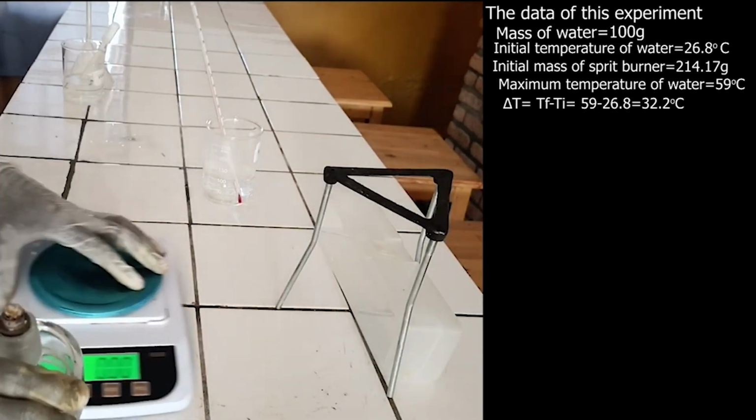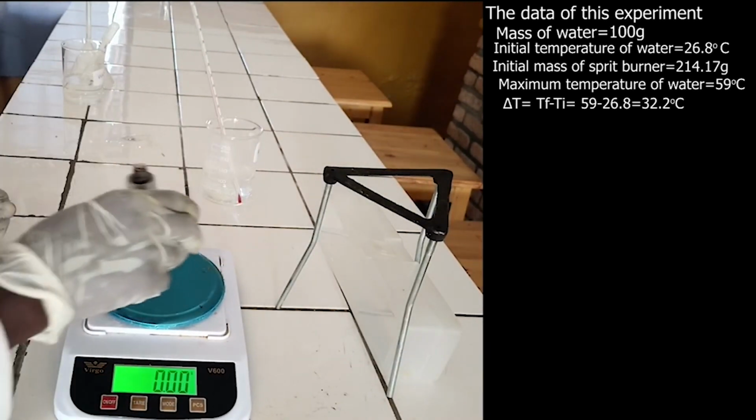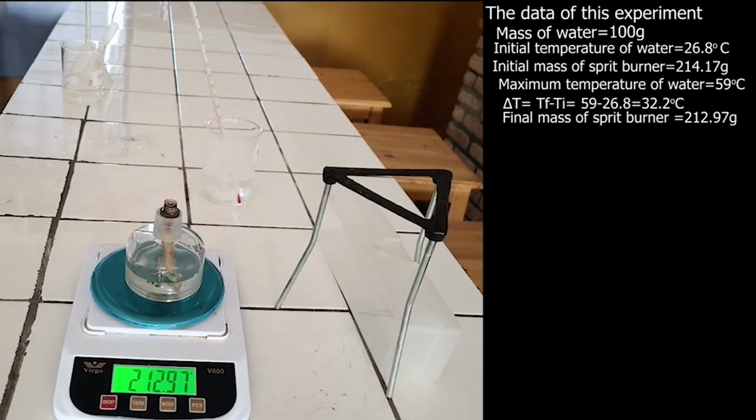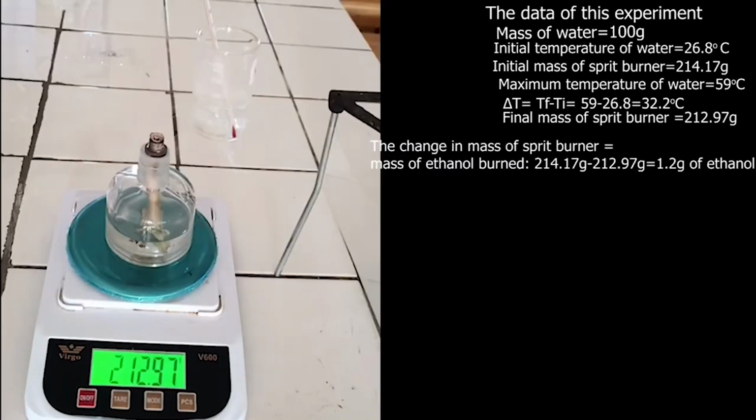During burning of alcohol, the mass of alcohol decreases, hence the mass of both spirit burner and ethanol decreases. The mass of spirit burner and ethanol after burning is 212.97 grams. The difference in mass before burning and after burning is equal to the mass of ethanol burned. The mass of ethanol burned is equal to 1.2 grams. By converting mass of ethanol burned into mole, the mole of ethanol burned is 0.026 mole.